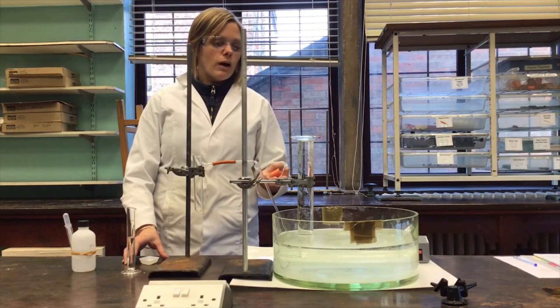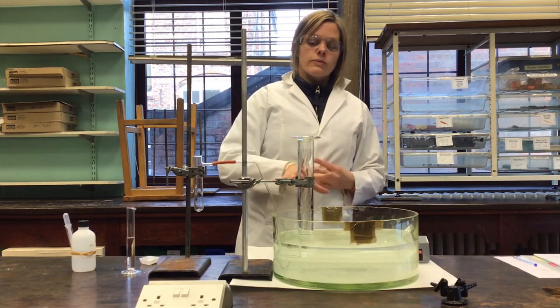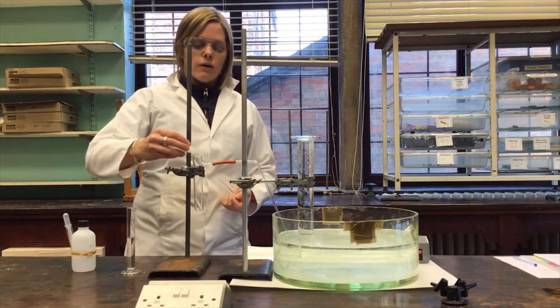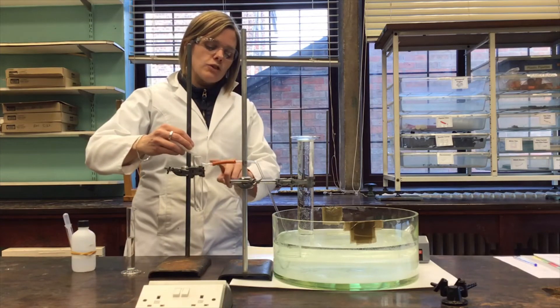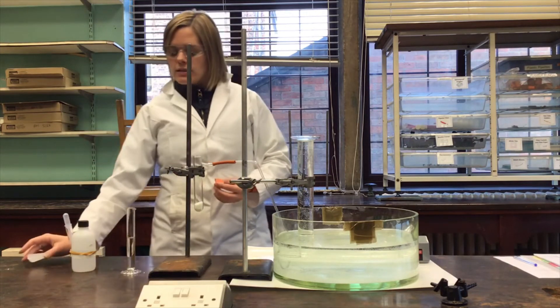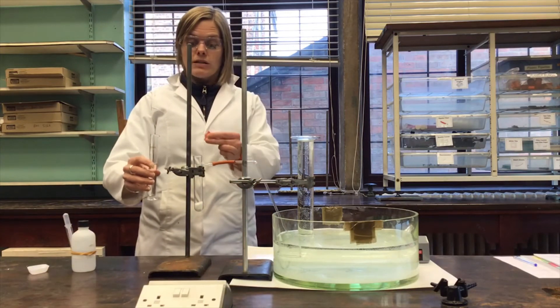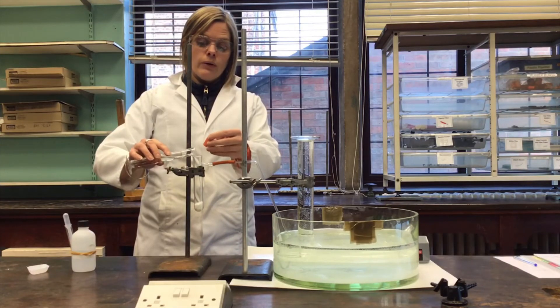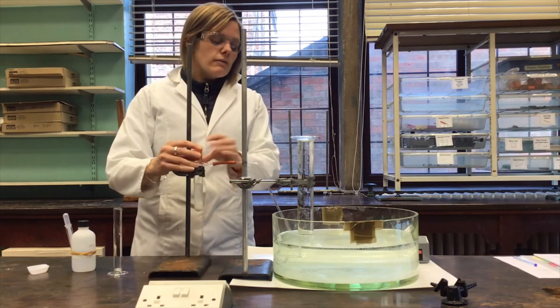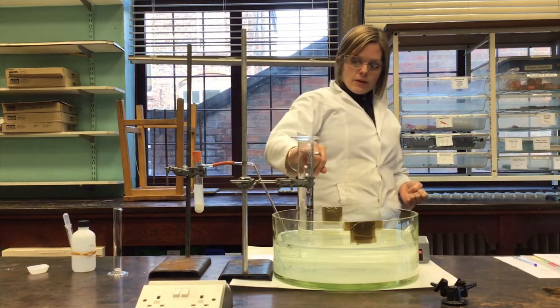This is a second example of monitoring rates of reaction by continuous monitoring. Instead of a gas syringe, there's a measuring cylinder here with a scale on it. The instructions say to add about 10 grams of small marble chips to the side arm tube, so I'm going to pop those straight in. Then to add 20 centimetres cubed of 1.0 moles per decimetre cubed hydrochloric acid and replace the bung really quickly. The apparatus starts to bubble, and the bubbles go straight into this measuring cylinder.